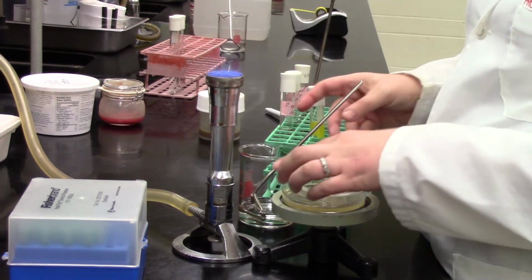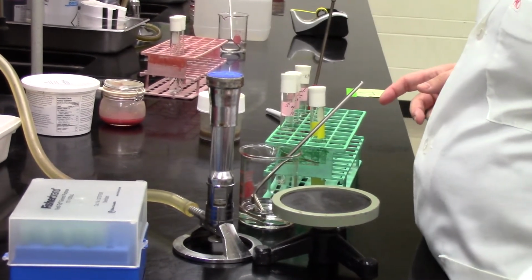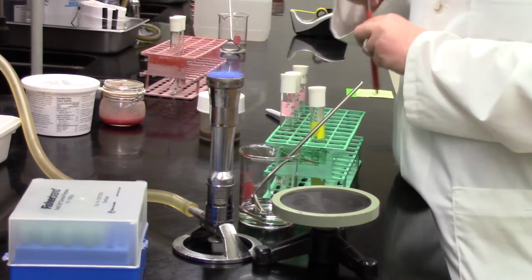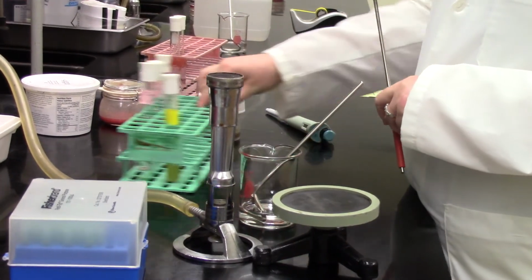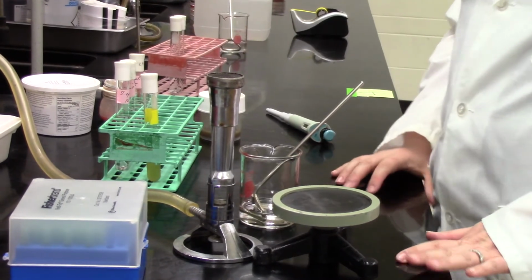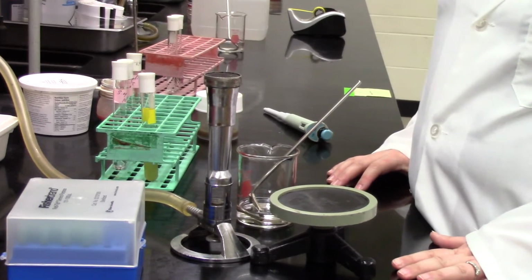As you go forward, you'll see we're going to make some much more elaborate dilution series than that, where we dilute all the way down to, say, 10 to the minus 10. So this is a simple one. We might do a few extras for these food samples, not on video, but just for you guys, in case we still have a lot of bacteria with our 10 to the minus 1, because it's not uncommon to have quite a few bacteria in there. Especially the meat juice.